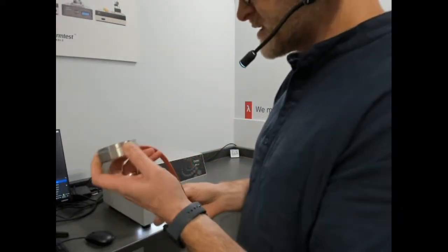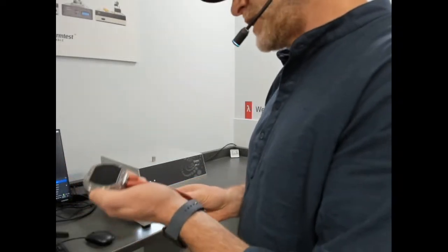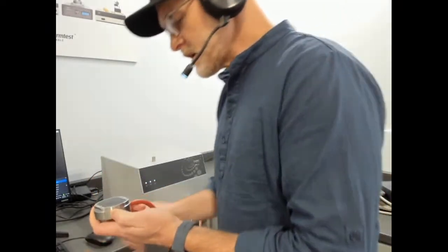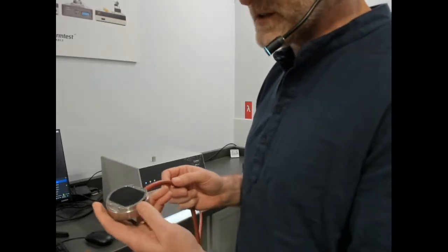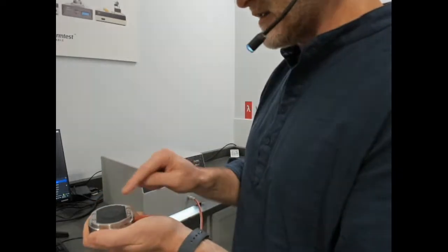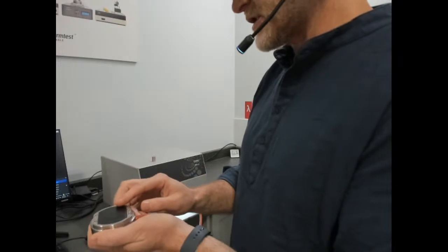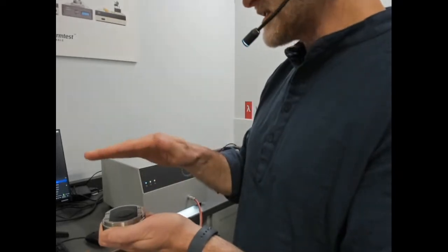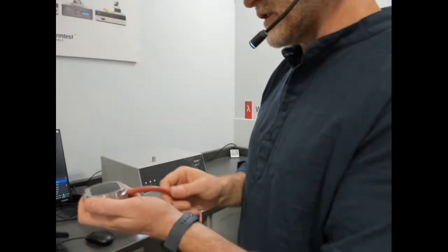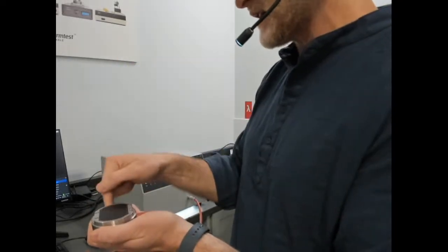In fact, this MTPS sensor that we described as the absolute version of the MTPS sensor is extremely capable. So let me talk a little bit about this. There are videos showing the construction of this, but essentially it is a double spiral sensor sitting on top of insulation, where the standard configuration of a transient plane source sensor is the sensor sitting between 2 pieces of the same material. In this configuration, we have a known backing material, insulation. So we know how much heat is leaking into the backing, and that's part of the calculation. And then we measure what's on top of it as an unknown.